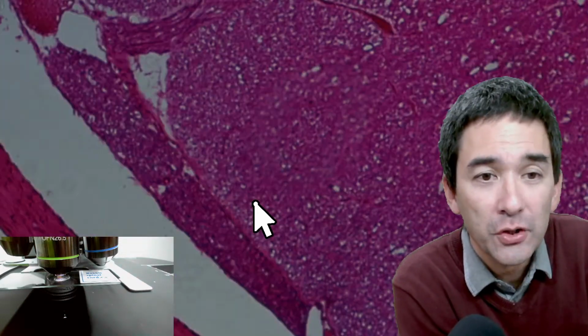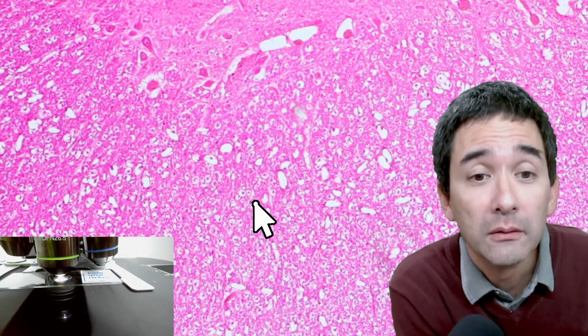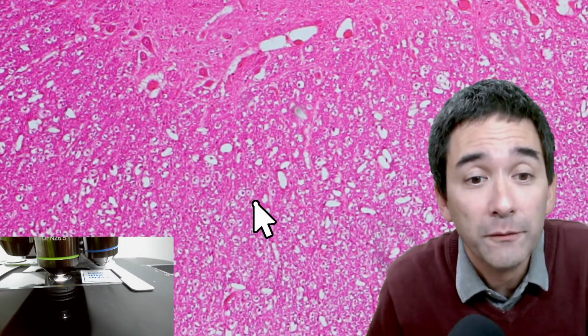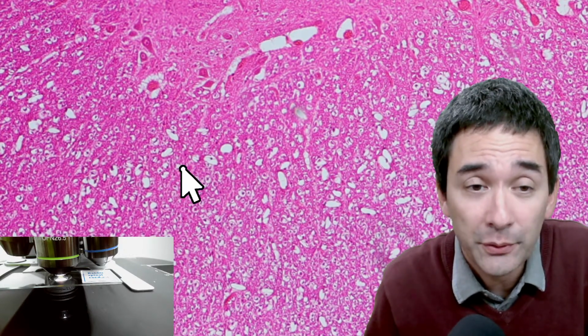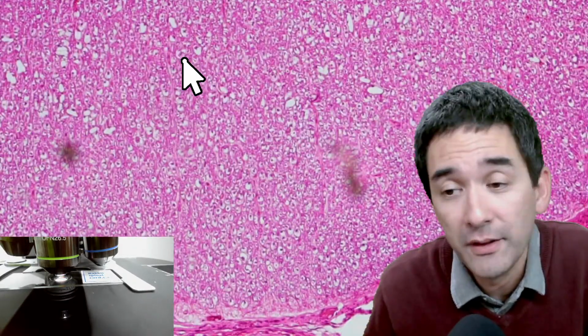First of all, the problem that I have is identifying them. What's a blood vessel here? Or cell density, it's also something you might measure. It's a little difficult to see here, but if you were to see the blood vessels, you can count them, measure out from where to where is 1 millimeter, and then you have 1 square millimeter, and you count how many blood vessels you have in there.